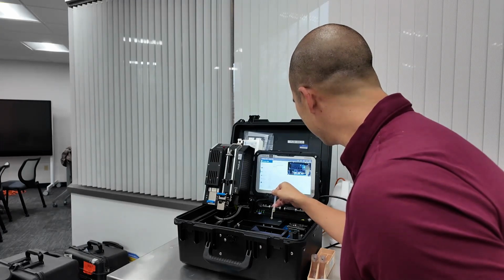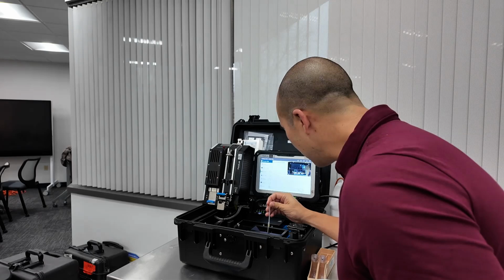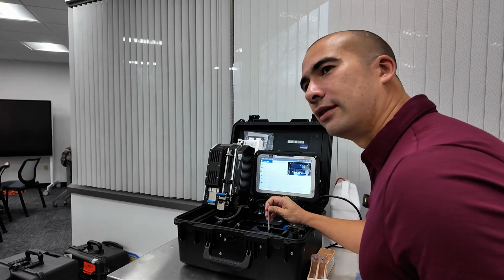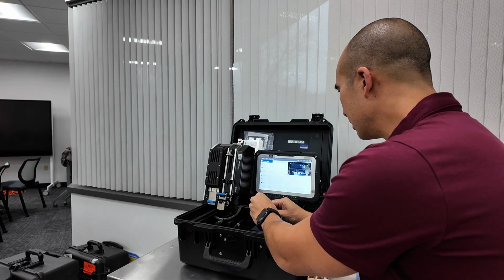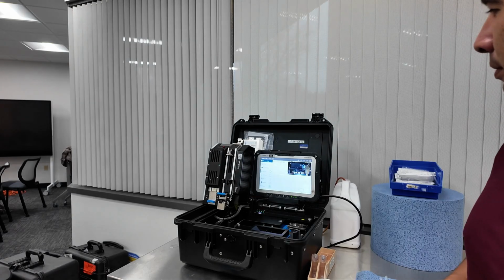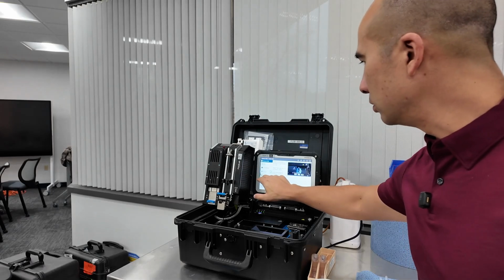Hang on. Start. Okay, going to insert the sample here. Oops, do I just put that here and hold it? Press the valve on top. And when it's done, pull it out and then release. All right, so while the viscosity is measuring, we can go to chemistry.